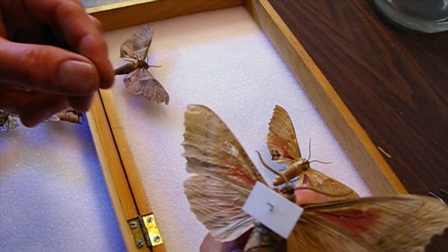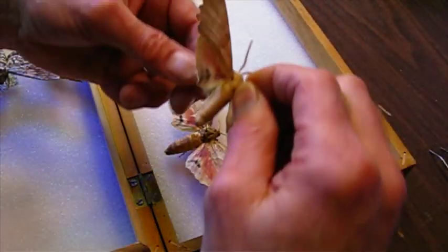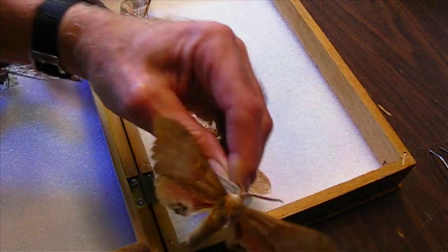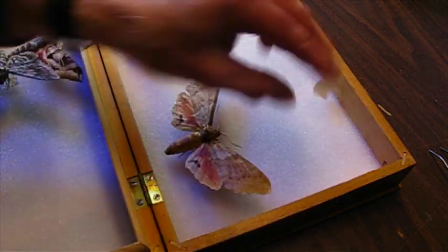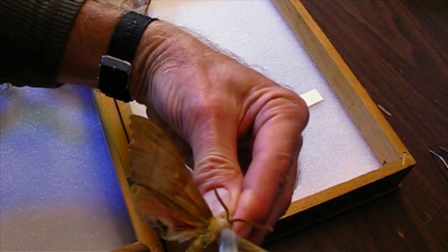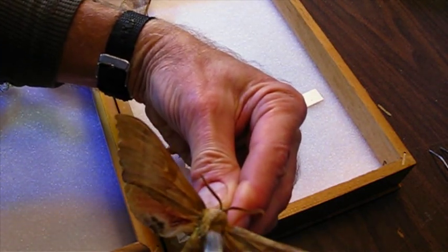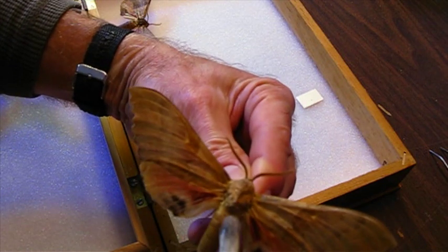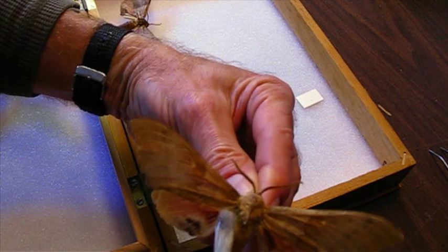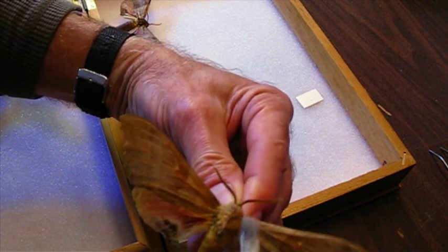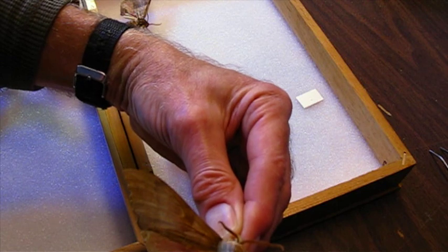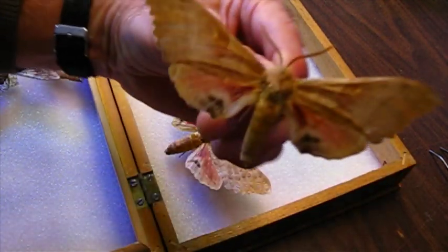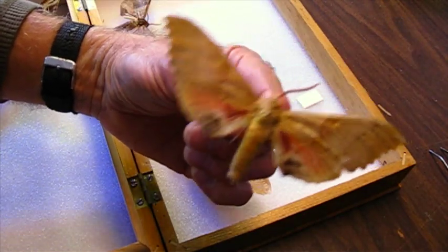This one too, this one was really covered with it. I'm going to fix this matting here a little bit, fluff it up just a little. You can't even tell that that was moldy before.